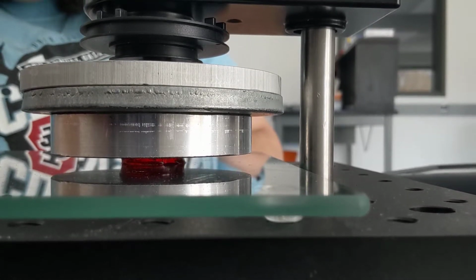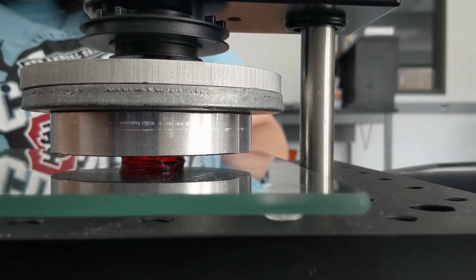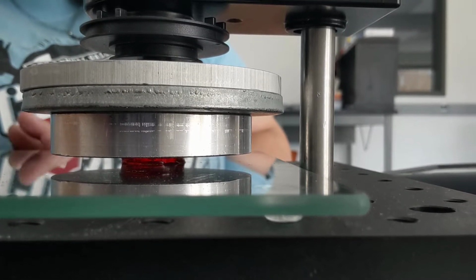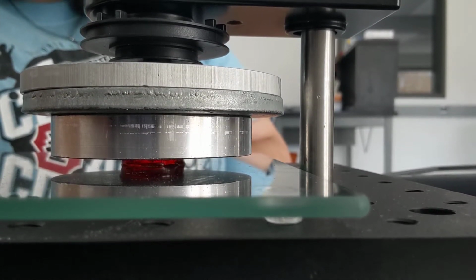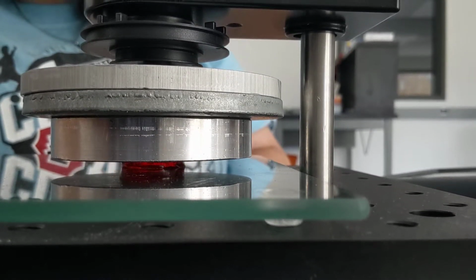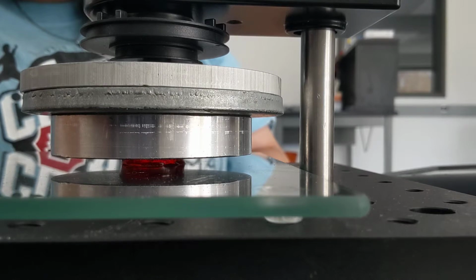I've used some red Jell-O, and I made it according to the box directions for Jell-O Jigglers. This makes it a little bit of a stiffer texture. It won't fall apart when you try to cut it or pick it up in your hands, and it's really ideal for this kind of work.